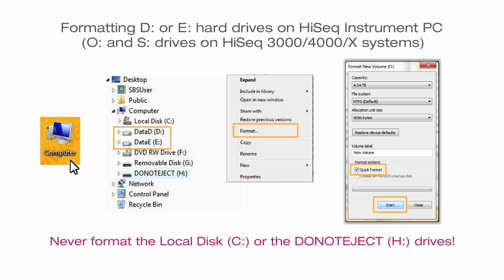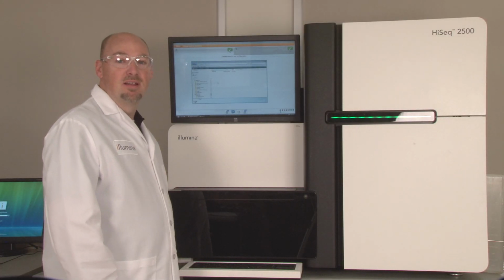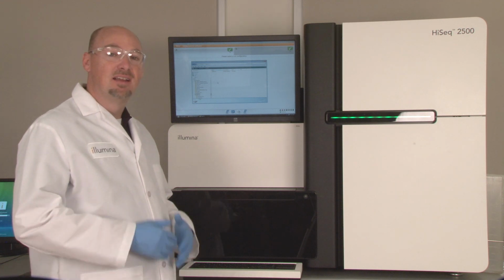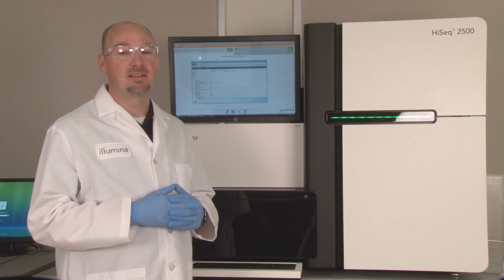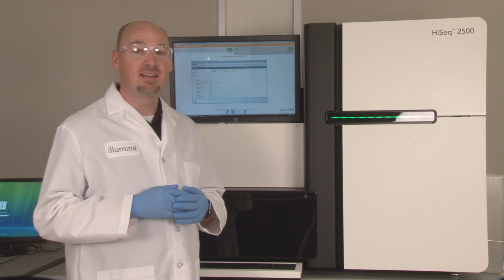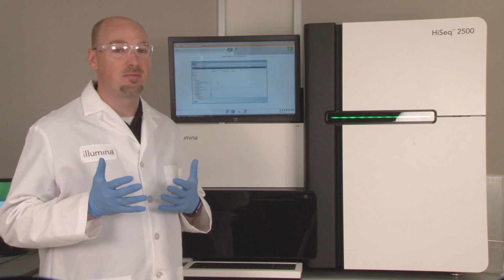Important log files are stored on the C drive that, along with the Do Not Eject drive, should never be formatted. So it is okay to perform these steps while the instrument is performing a wash. If disk space drops below the safe threshold during the run, the software may pause the run and place the flow cell in a safe state. After disk space is made available, the run resumes automatically. However, this increases the overall run time, leading to inconvenience and delays, so it's best to format the appropriate drive before each run.